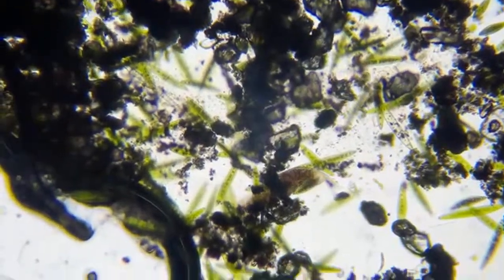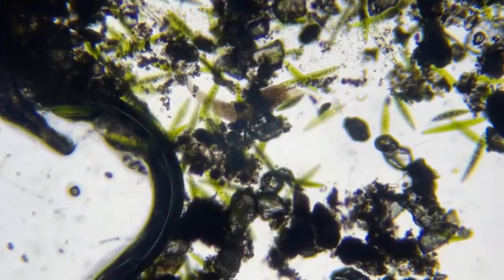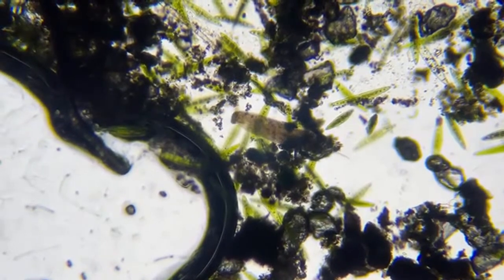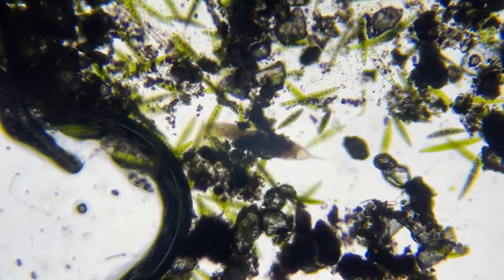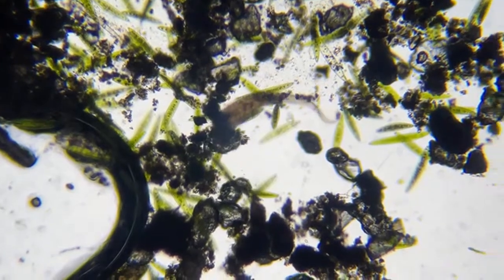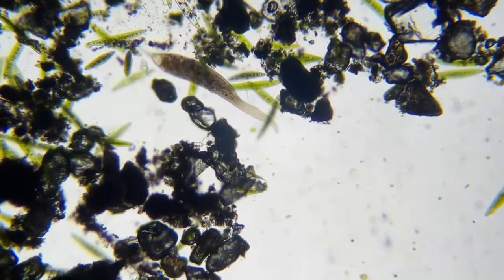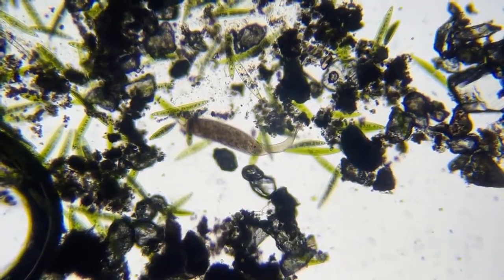And these were actually in a mud puddle. All this stuff came from a mud puddle. Usually if you have this algae in your mud puddle, it means there are no chemicals or anything polluting the puddle. But of course, if algae blooms get out of control, even though they do make oxygen, they tend to float on top of the mud and the surface, and block all the sunlight for the rest of the things, and the other life below them will die. So algae's good and algae's bad.